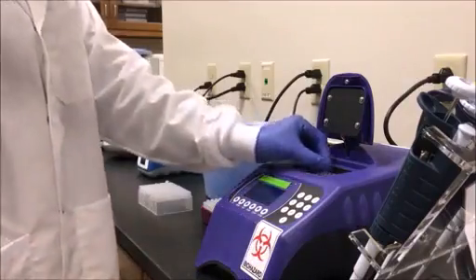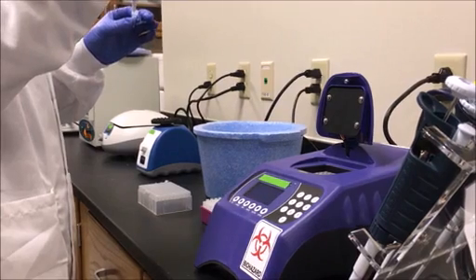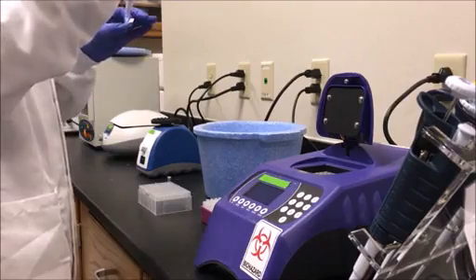After PCR, the amplified material is added directly to the kinase ligase DpnI enzyme mix for 1 hour at room temperature for circularization and template removal.